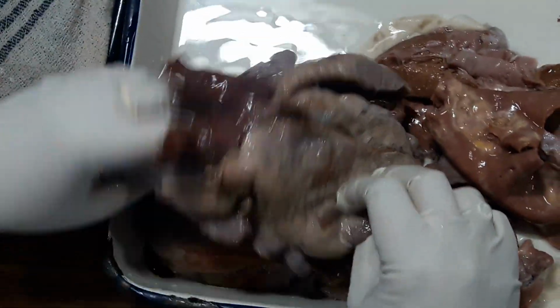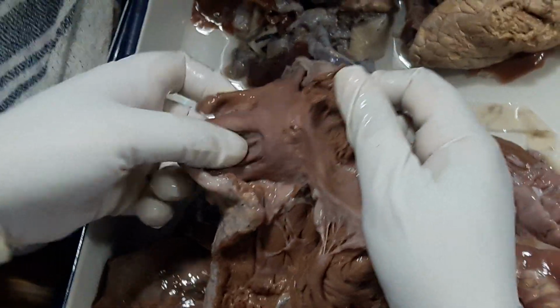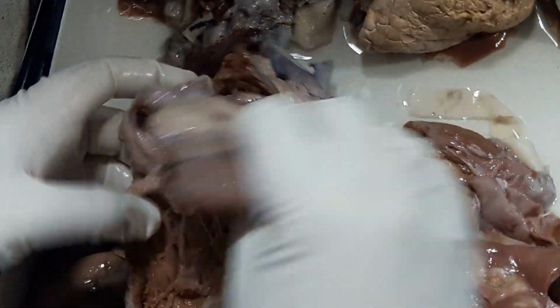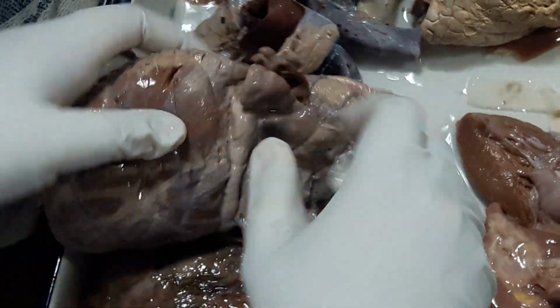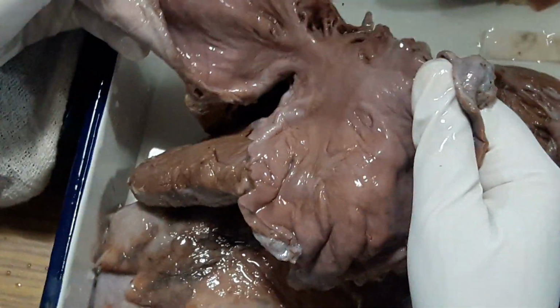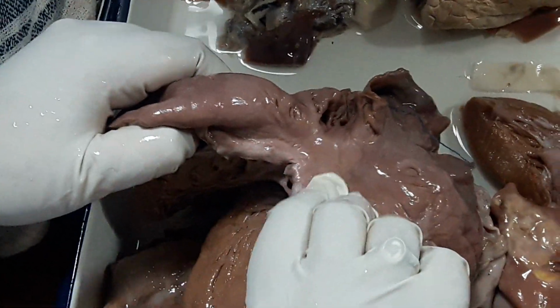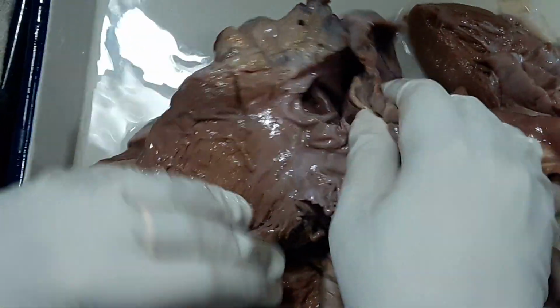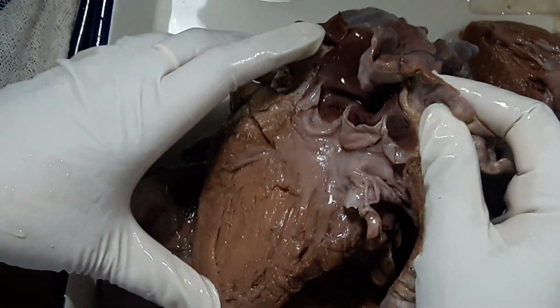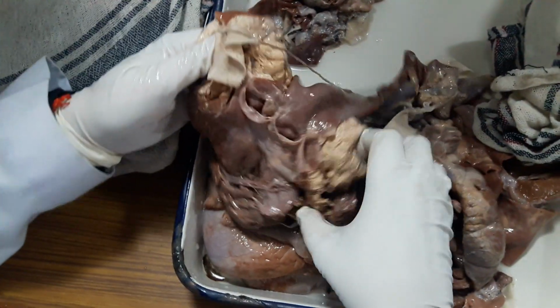Hold it in anatomical position, externally unremarkable. Right side. This is the fossa ovalis, limbus. This is the tricuspid valve, unremarkable. This is the pulmonary artery, unremarkable. Where is the problem then? See, left atrium is dilated. There is thickening of the mitral valve with chordal shortening. Okay. Aortic valve is not involved. So this is a case of mitral involvement in chronic rheumatic heart disease. Mitral valve involvement in chronic rheumatic.